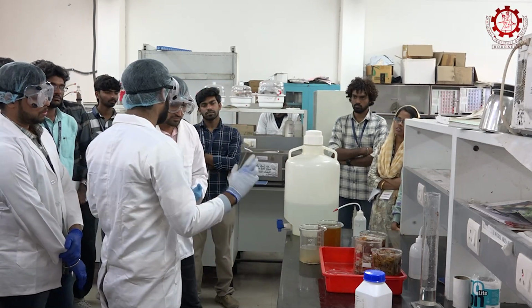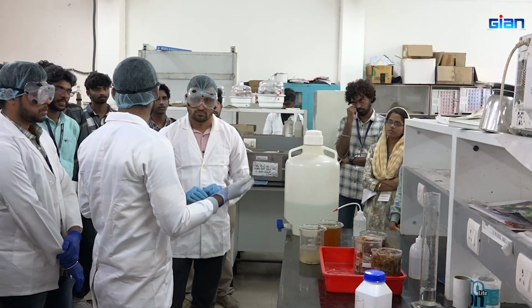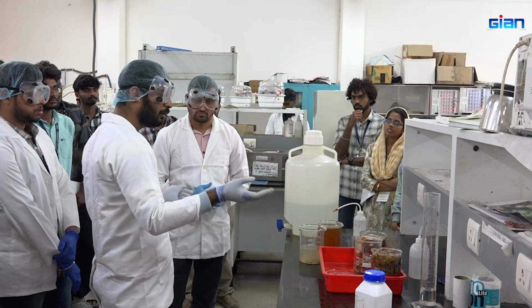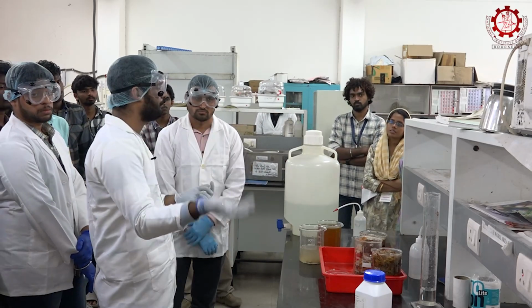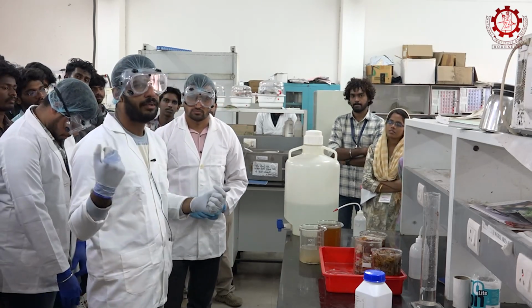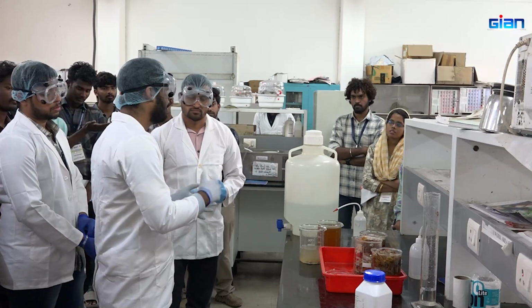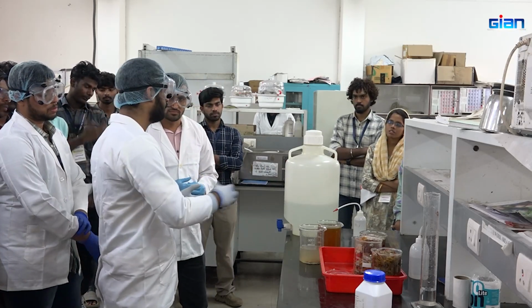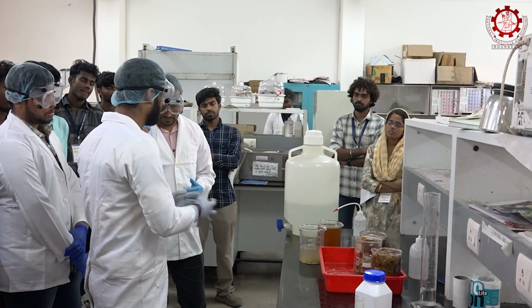But here the major aim is deproteinization. So even if it is 0.5 or 0.6 normal, it doesn't matter. Whatever it is, we can prepare it properly, and the major focus of our addition of NaOH is to deproteinize the fraction or the shells.